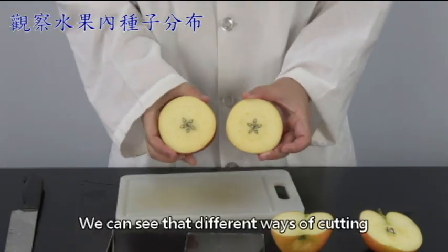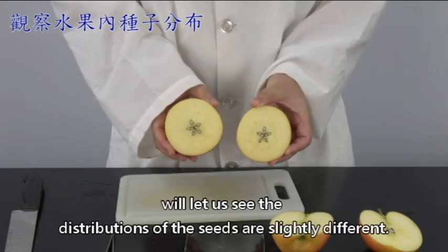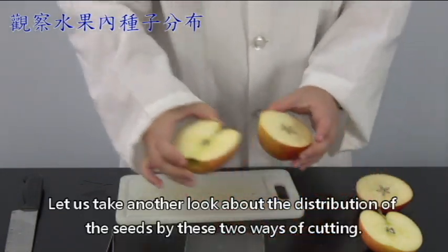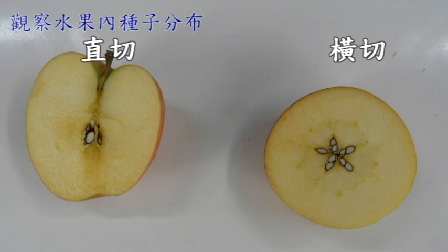We can see that different ways of cutting make the distribution of the seeds look slightly different. Let us take another look at the distribution of the seeds by these two ways of cutting.